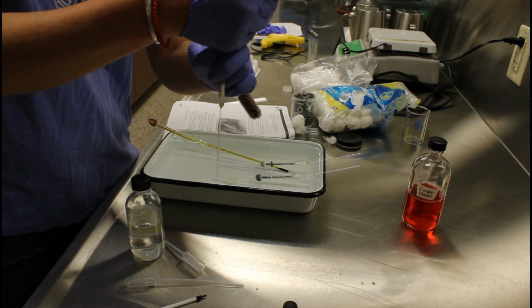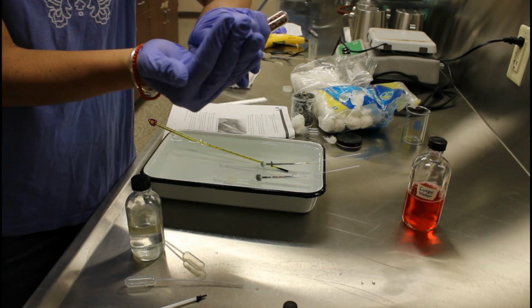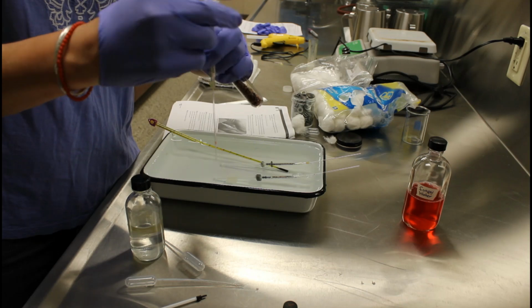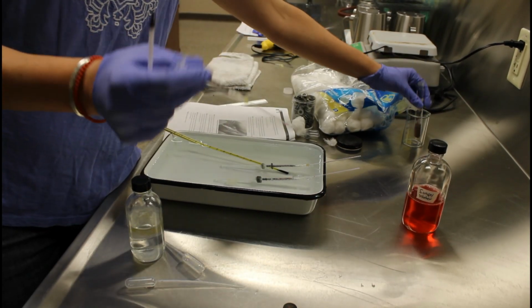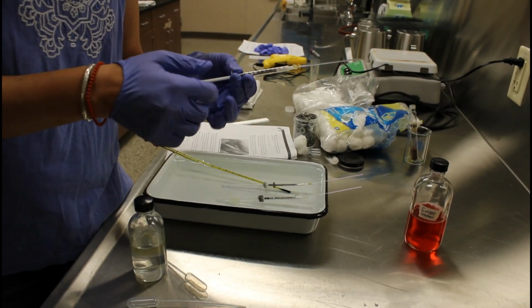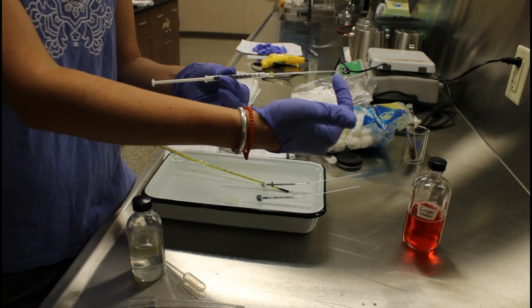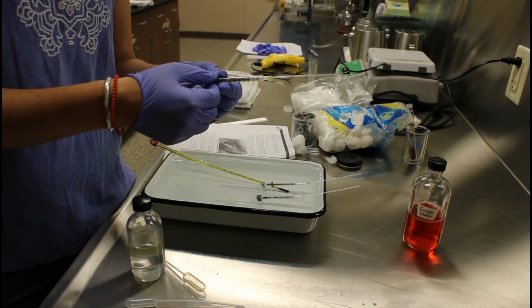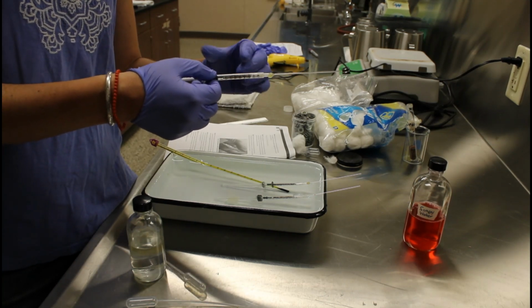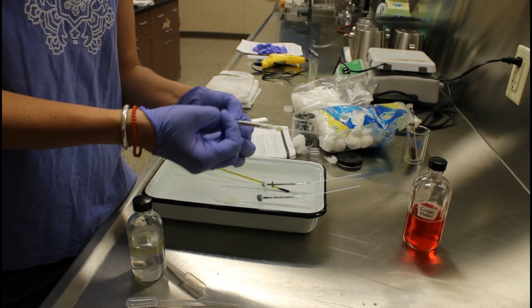So we're just going to dump them in there until we're at 0.7. I need a little bit more. And so this is it. I'm going to put the plunger back at 1 milliliter. Eventually we're going to seal up this side of the chamber and hopefully we'll be able to watch the seeds that are inside of the micro respirometer change the volume of gas inside this chamber as they consume the oxygen that's inside, as they perform cellular respiration.